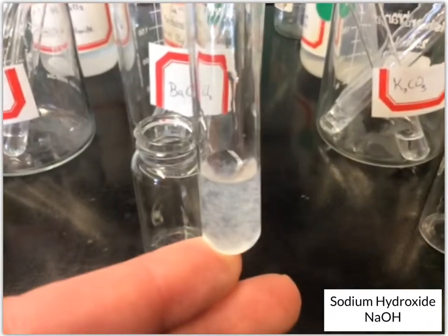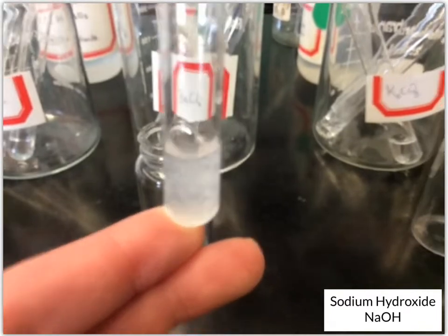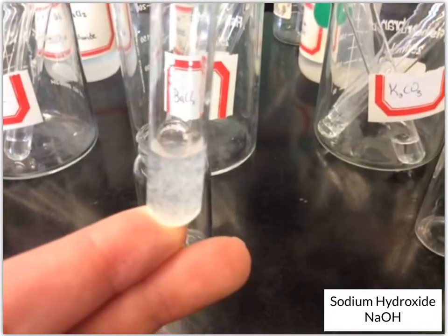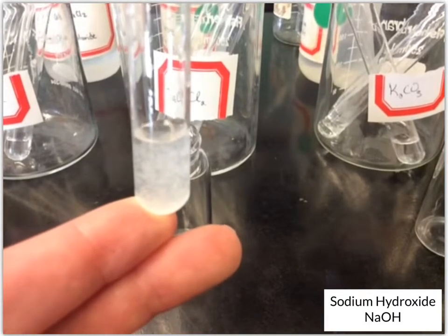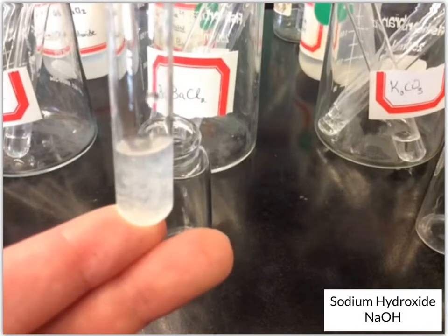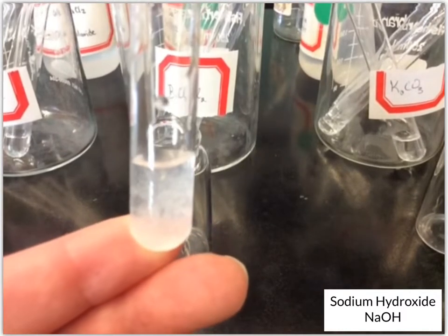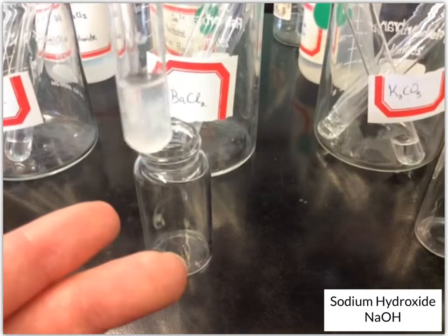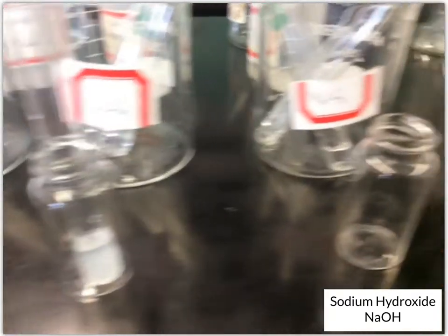Okay, now this one we've also got some white in there. It's a little easier to tell. There's definitely some particles floating around in there. So it's almost a little bit between the magnesium and the calcium chlorides. It's a little more solid than what the magnesium produced, it looks like, but less than what the calcium did. But again, we definitely have a reaction there.